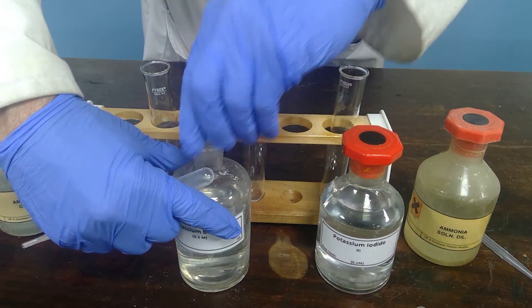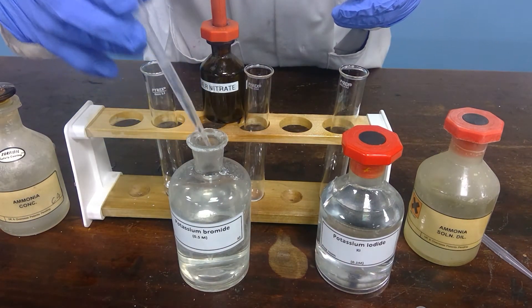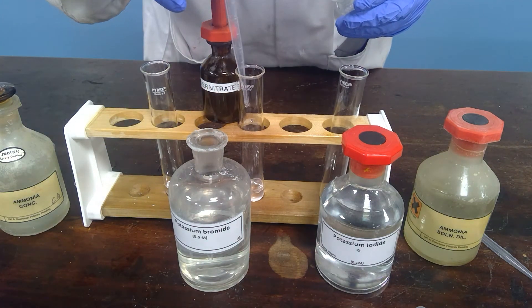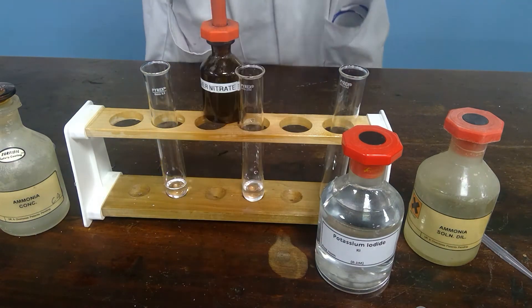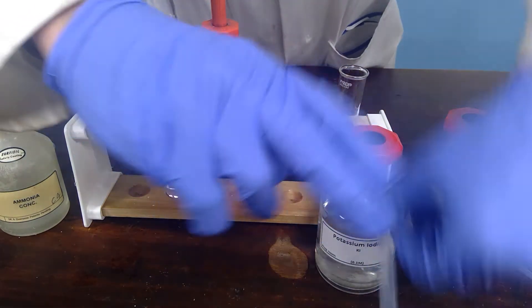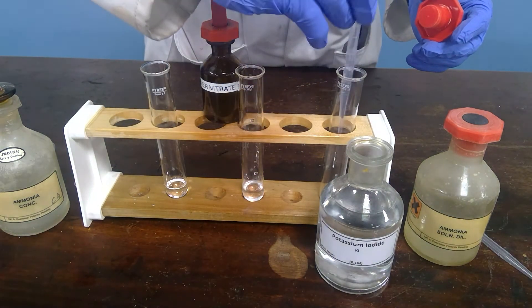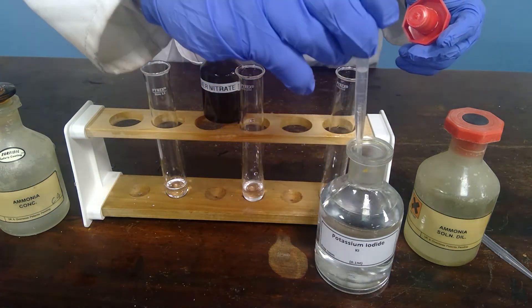The potassium bromide in the centre, into a boiling tube. And the potassium iodide into the boiling tube that is on your right.